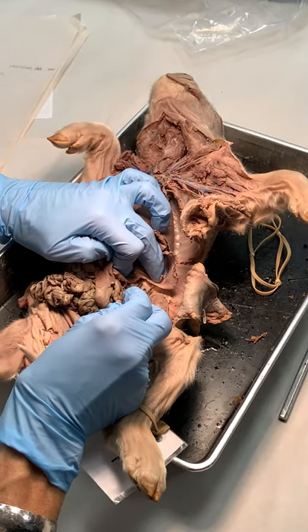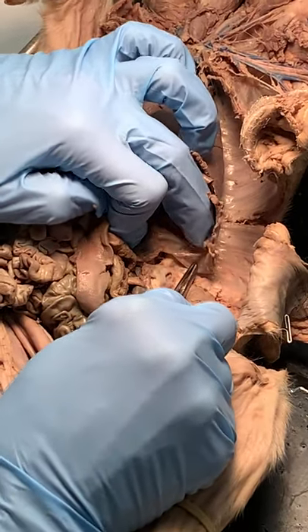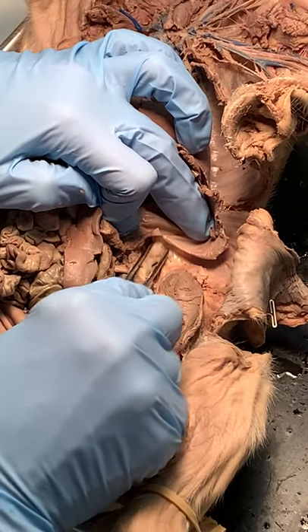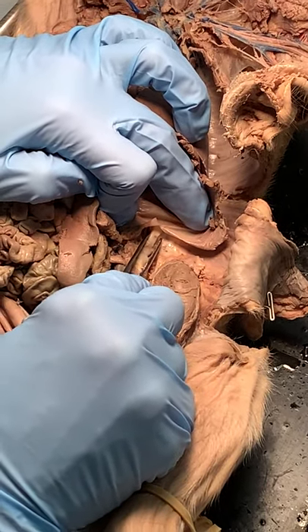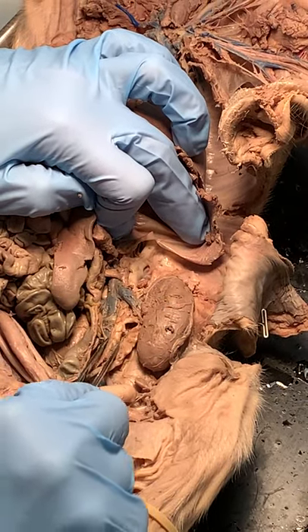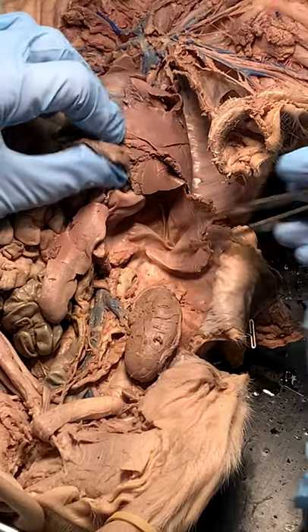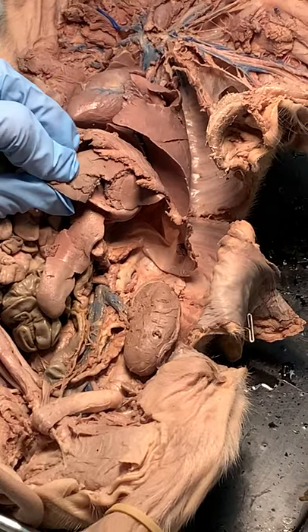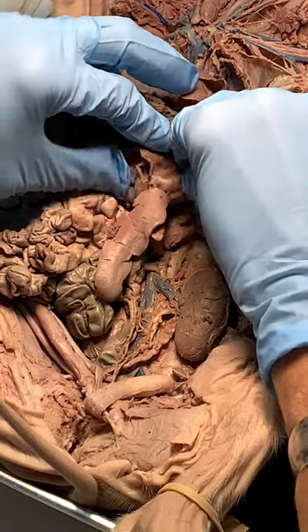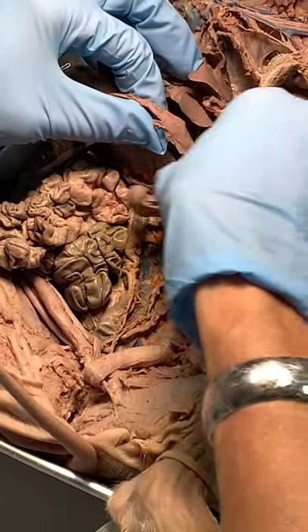Let me show you where it's coming through — right there. The diaphragm would have been connected right there, and there's a little opening right there where it comes through. That is where the aorta becomes the abdominal aorta as it runs down to the bottom and distributes all its branches. The first thing we need to feed is the liver, the stomach, and the spleen.